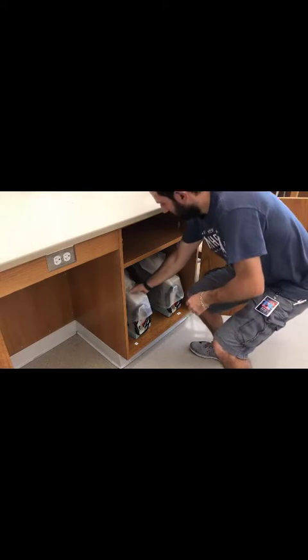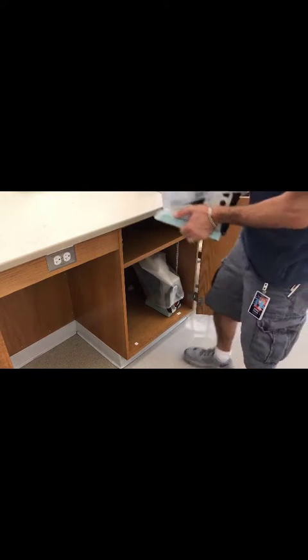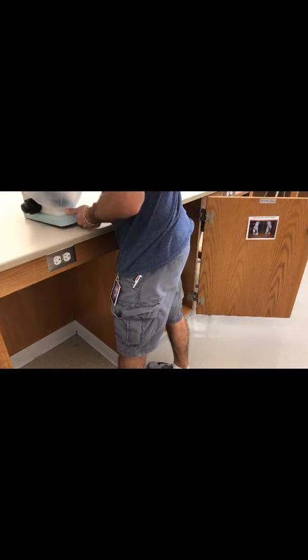First, retrieve your microscope. Make sure to grab it by the arm up here and the base below. Place it on your table with the ocular or eyepiece pointed towards you.